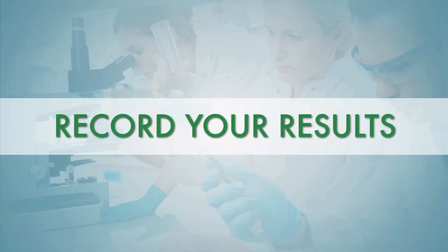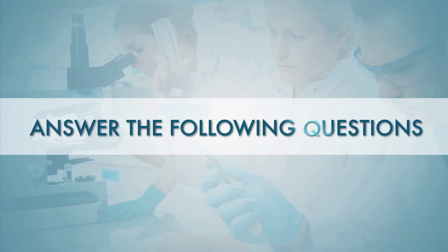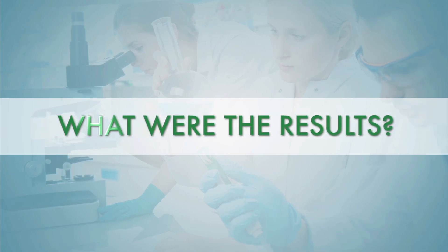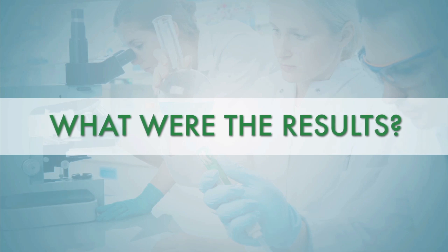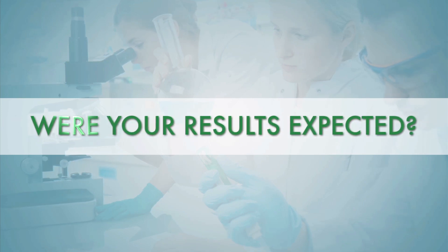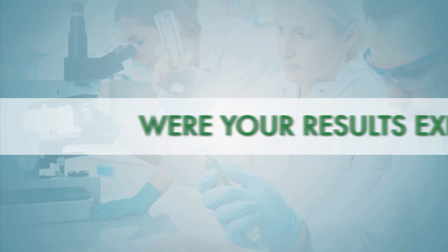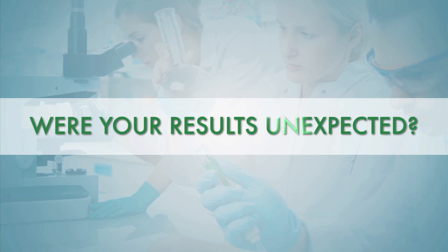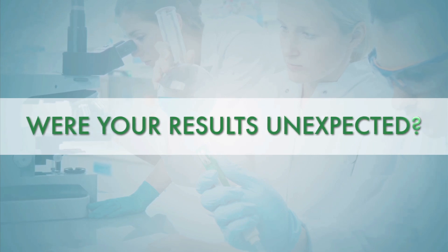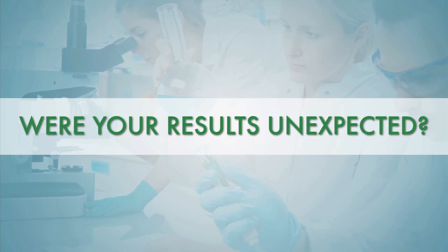Now that we've completed the starch experiment, please work through the same conclusion questions for each test tube: one, what were the results? Two, were your results expected, and why or why not? Three, if your results were unexpected, please explain why, indicate possible reasons, and include what you would do going forward given the result.